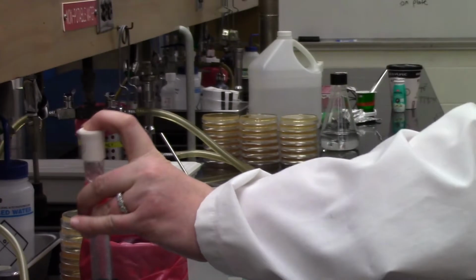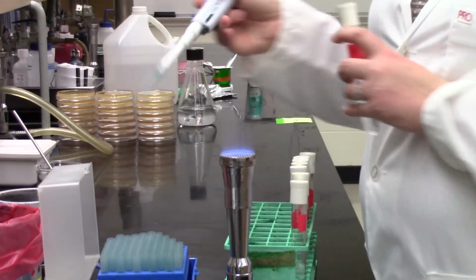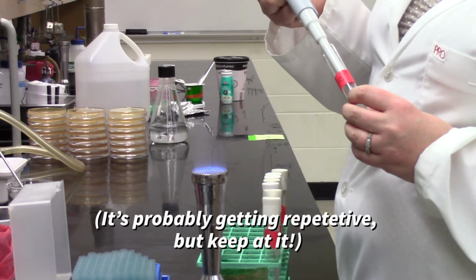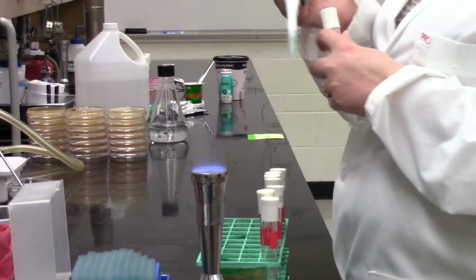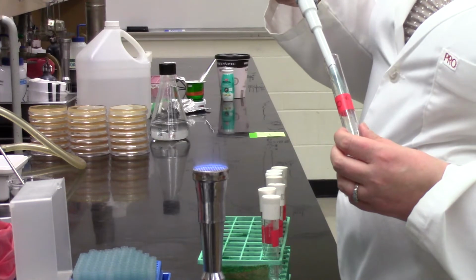And once again, there goes the vortex again. She is mixing again, because every single time you go to a new tube in your dilution series, you have to mix what you're taking from first. So here she goes, taking another 1 mil. And this is just going to keep going like this until she's made her whole dilution series.